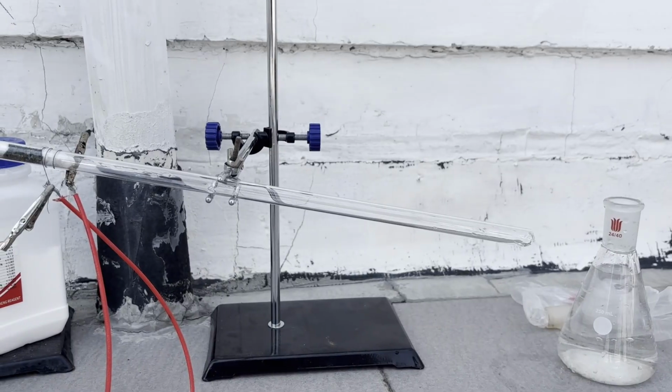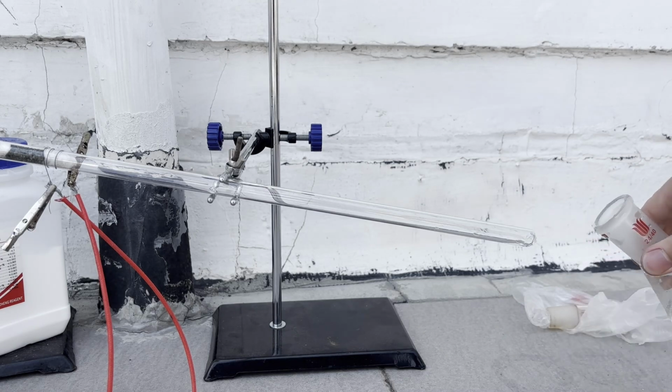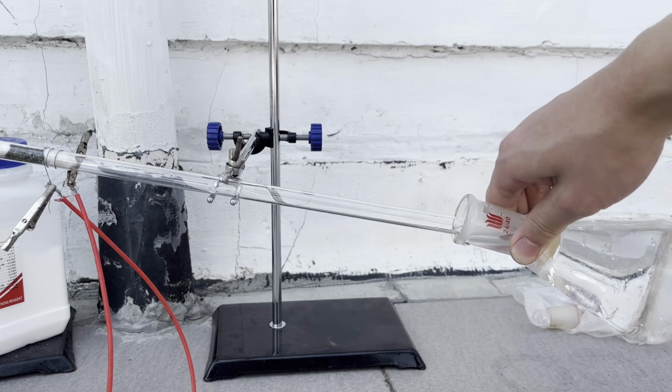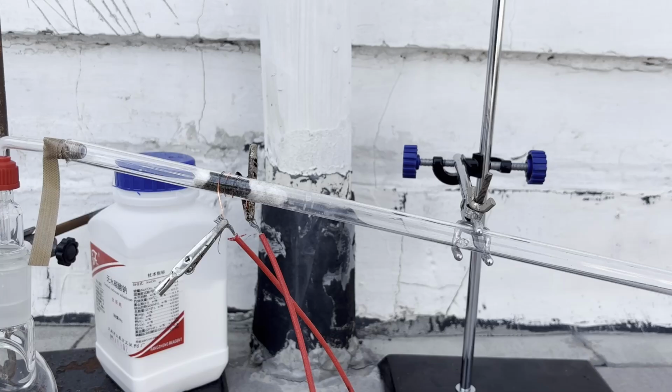I tested the airtightness of the apparatus by turning on the pump and passing air through the flask filled with water. Because I have to break the quartz tube to remove the filament originally inside it, the 2 ends of the tube are not smooth, and an airtight seal cannot be easily created, which was quite annoying. However, infrared heaters are probably the cheapest and most cost-effective way of obtaining quartz tube, as this heating element only cost me 15 yuan or $2, so I'm going with it anyway.